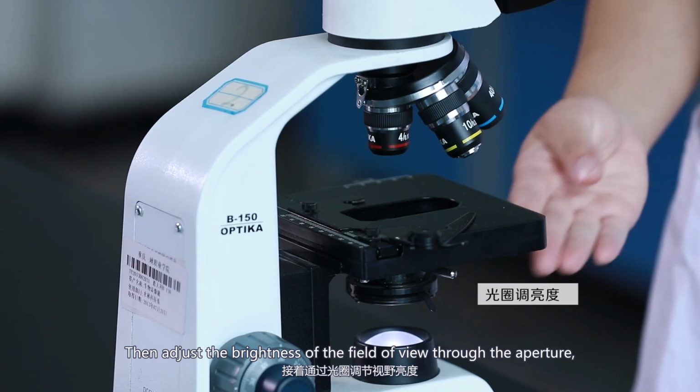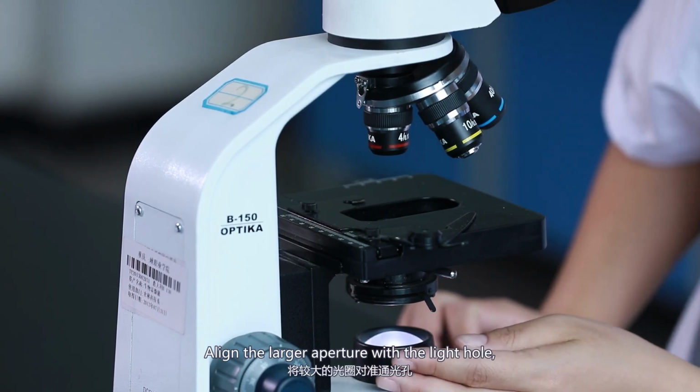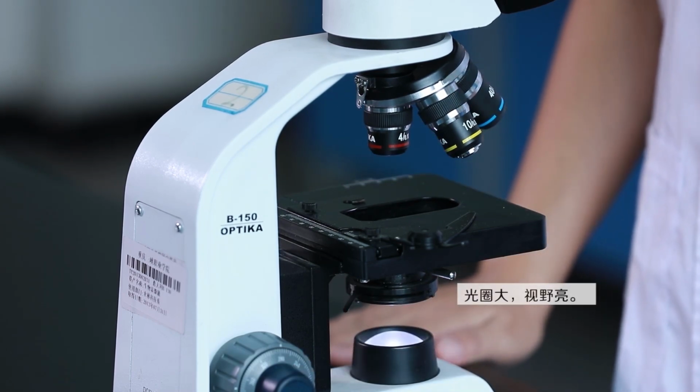Then adjust the brightness of the field of view through the aperture. Align the larger aperture with the light hole. The larger the aperture, the brighter it will be.